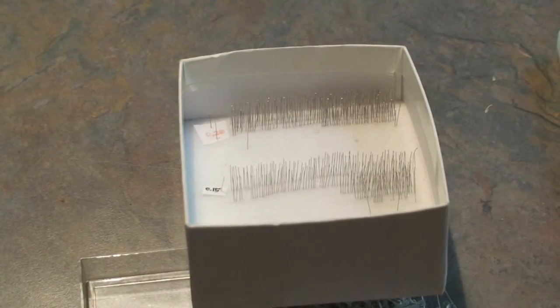Minutins of different size diameter are used depending on the size of the specimen.